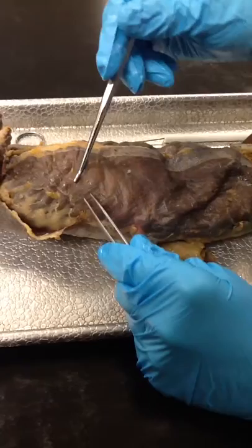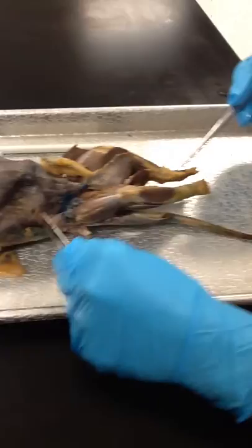And now the body. This is the latissimus dorsi right here, and this is external abdominal oblique.